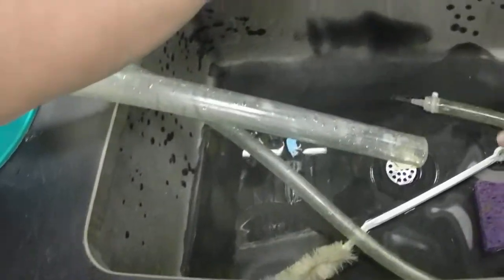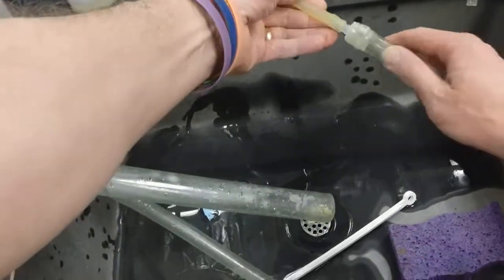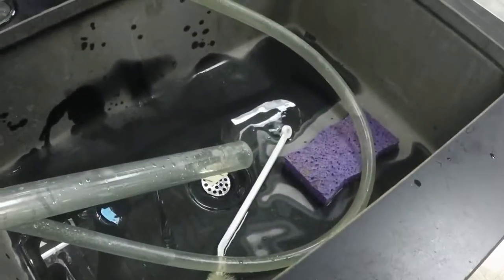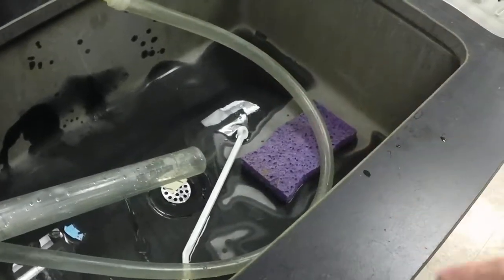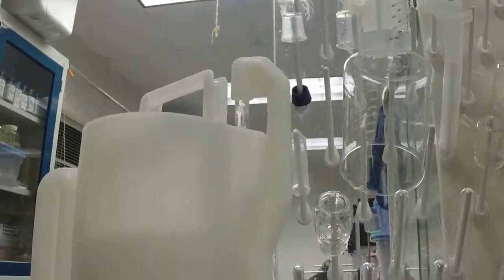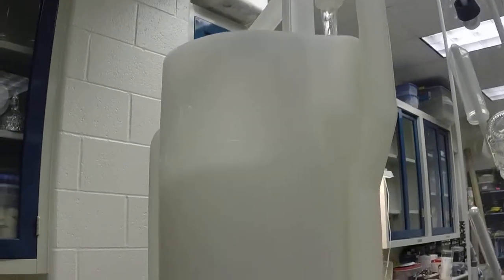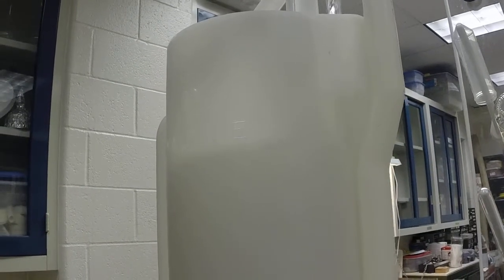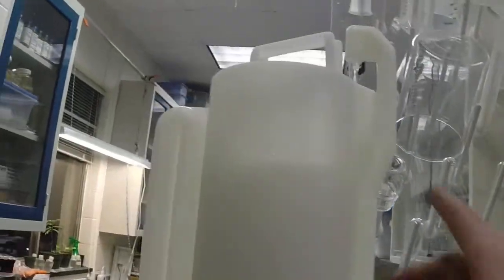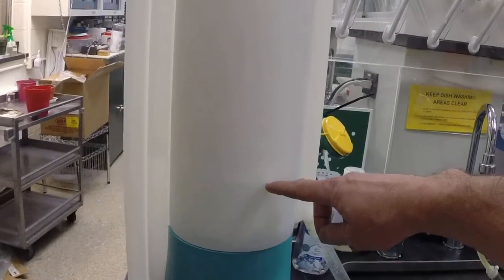What we've got going here now is simply attach the hot water to this in this case, and you'll see the water will start to run and that runs on up to the top of this. What you'll see is it comes out the top and you want that to come out reasonably fast—not too fast because you can actually stop it from cycling. You can see now the water level is raising up inside here.